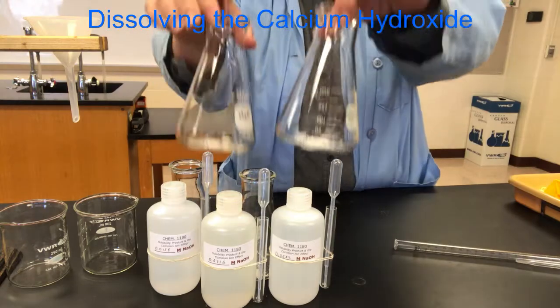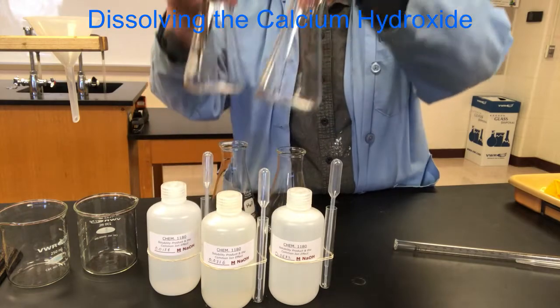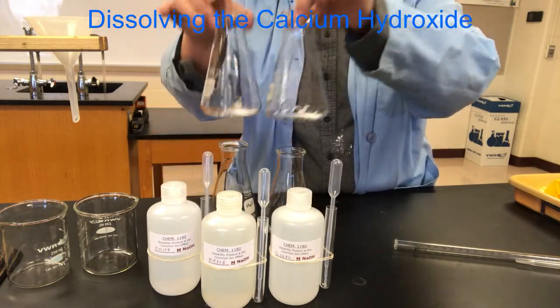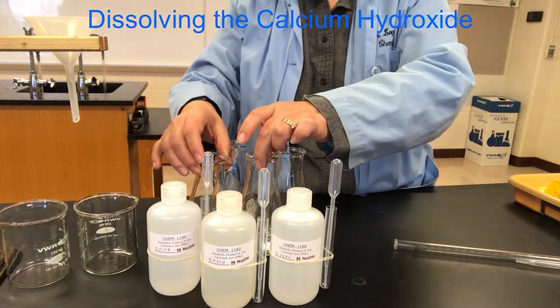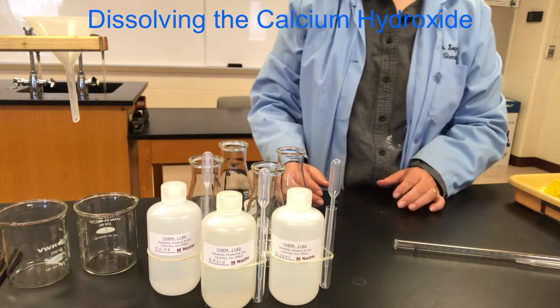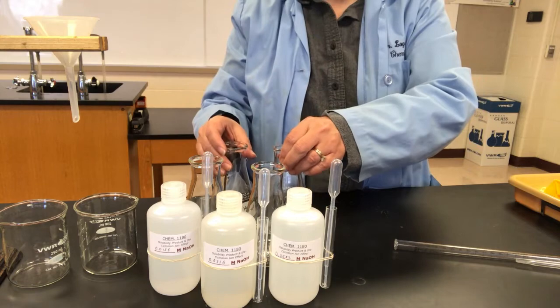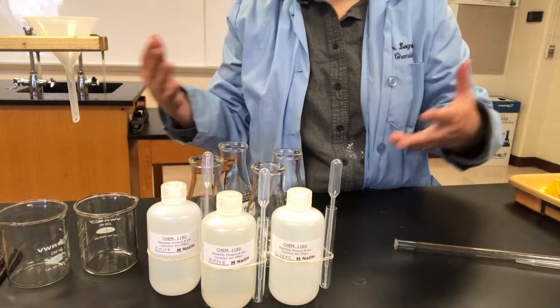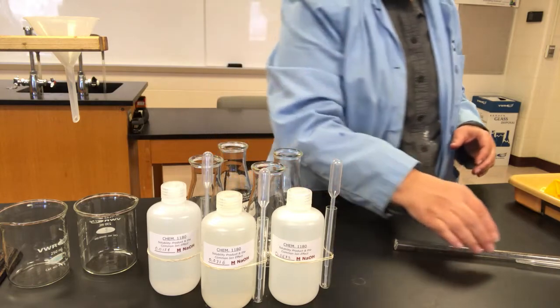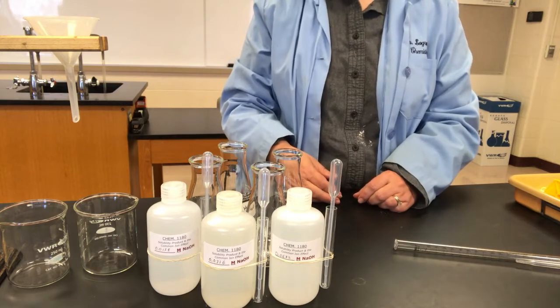I weighed out about 0.1 gram of calcium hydroxide and put it into 4 labeled Erlenmeyer flasks. The exact amount of calcium hydroxide in each flask is not important. Our goal is to saturate the solutions and dissolve as much of the calcium hydroxide in each solution as we can. So as long as we've added more than enough to do that, and not too much to make the filtering process difficult, that should be satisfactory.